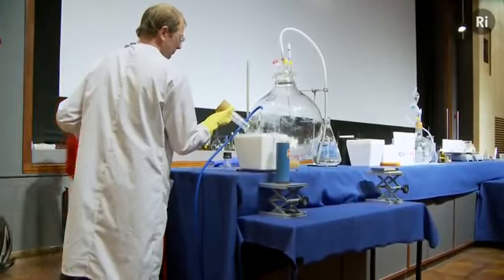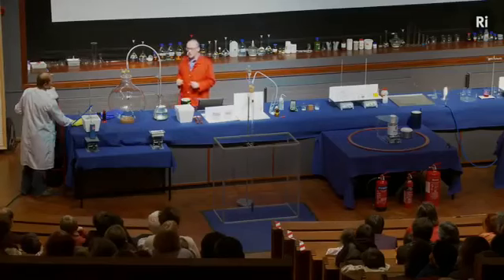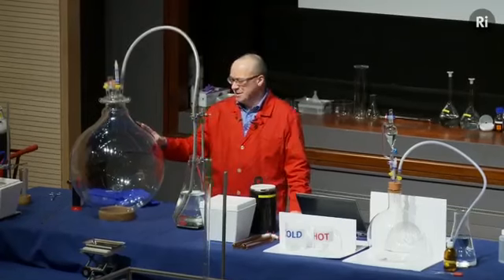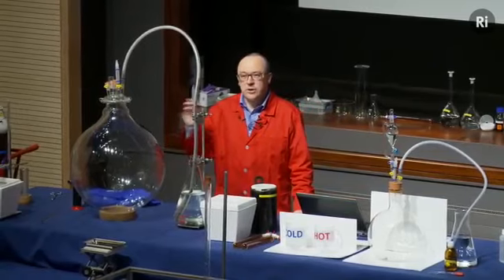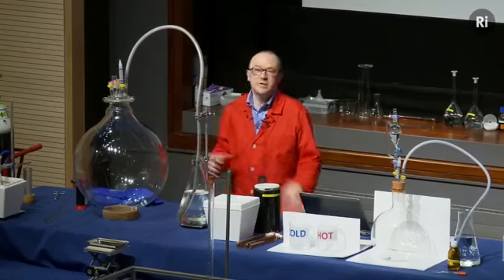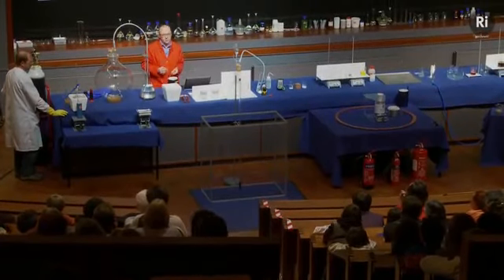So we could just burn a little bit of phosphorus on the bench, but what we thought we'd do is to scale this up and do this on the largest scale we could. And so this is actually the largest flask that you can buy in the UK. And so this is about as big as we can make it. And we're going to burn quite a big chunk of white phosphorus inside this flask. And to make it burn really well, we're going to fill the flask with pure oxygen. Now, in order to fill the flask with pure oxygen, we're going to use liquid oxygen.